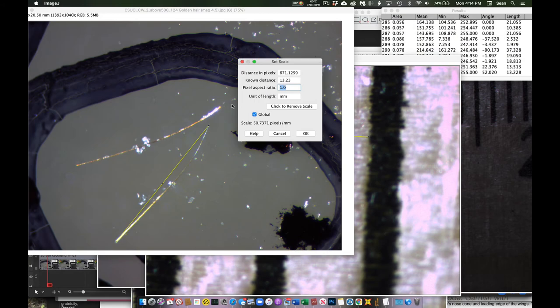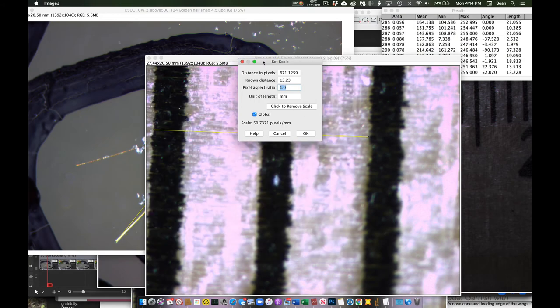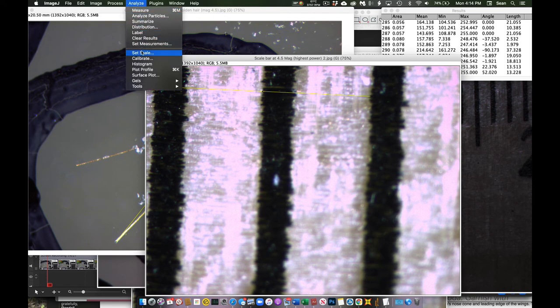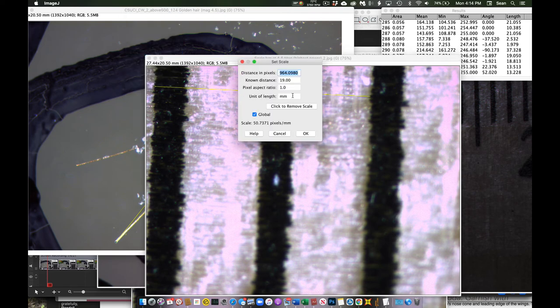cell right below it. So the proper way to do a calibration then is to come on up and say measure a given distance, in this case 2 millimeters, come up, hit set scale, come over here, in this case this is 2 millimeters, and so the known distance is 2. So this line that I just drew is this many pixels in this box. My known distance is 2.